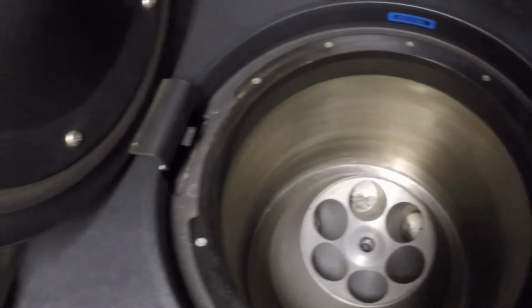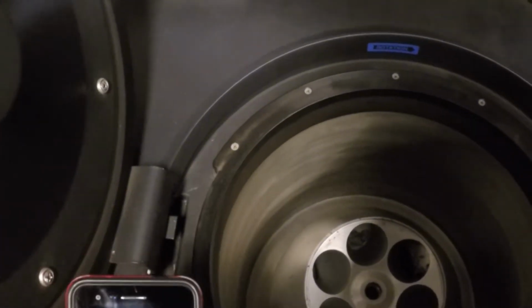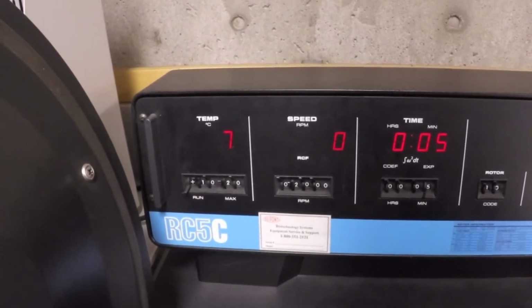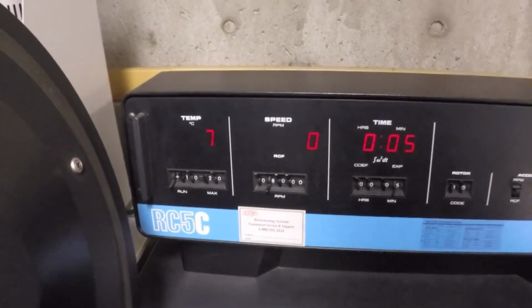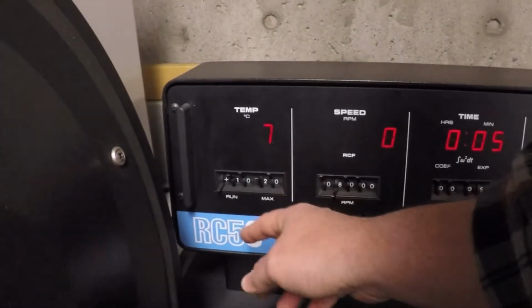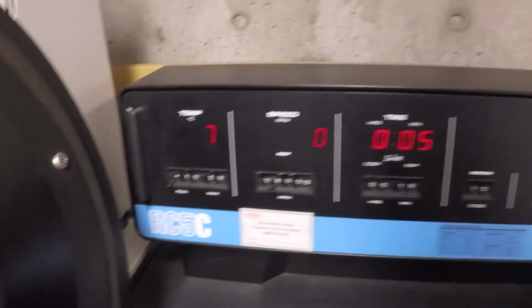So everything is fine. Our temperature is good. Don't have to worry about that. But what we do want to do is change our RPM to, we said 8,000 it was? There's 8,000. Okay, so I think we're ready. What's our time again though? I don't remember what our time was. Let's see. 10,000 times G for 10 minutes, okay? So, we have to change our time to, time, dummy, 10 minutes. And we're ready, okay?